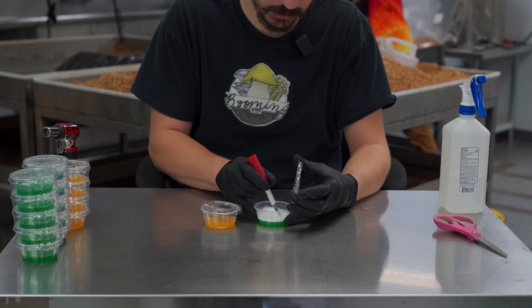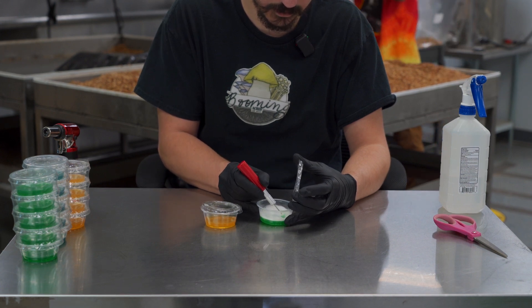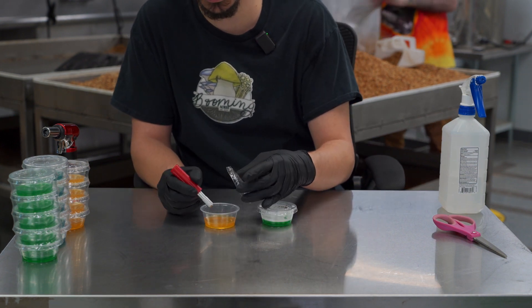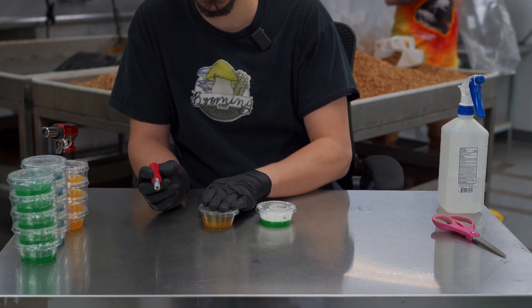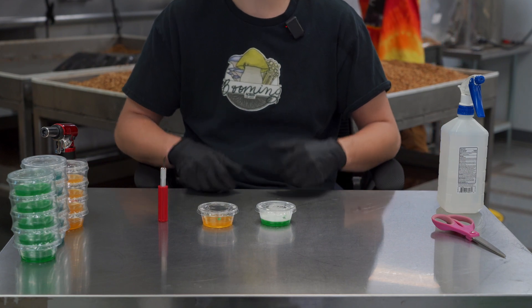Take the colonized cup, cut out a small portion of it, click the lid back on. Take your new cup, put your transfer onto it, clip it, and you're done.